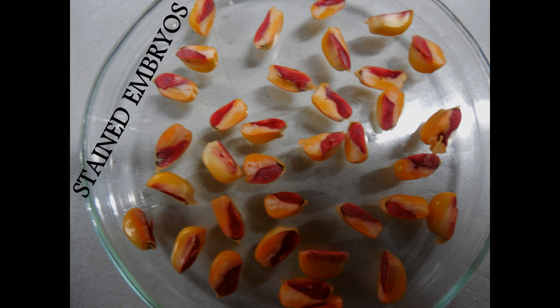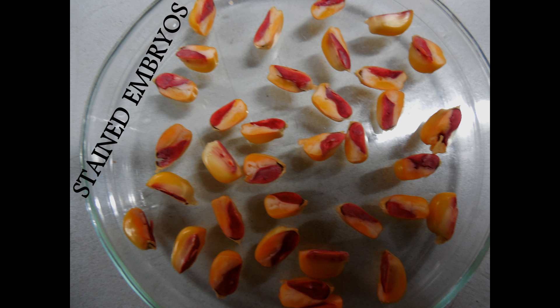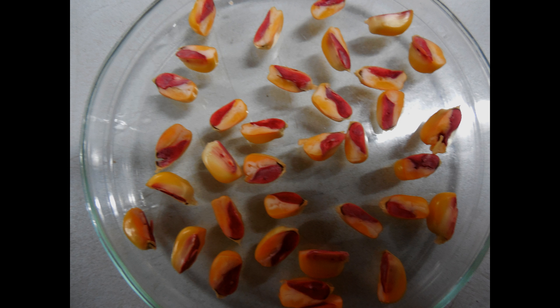Fully stained embryo: In this, the radicle, plumule, and the scutellum are fully stained.